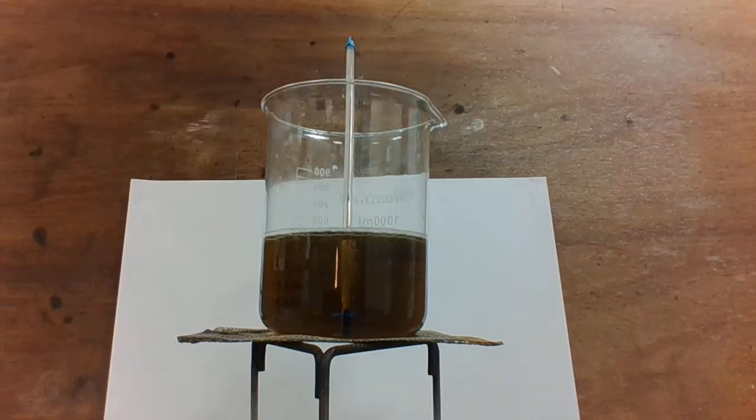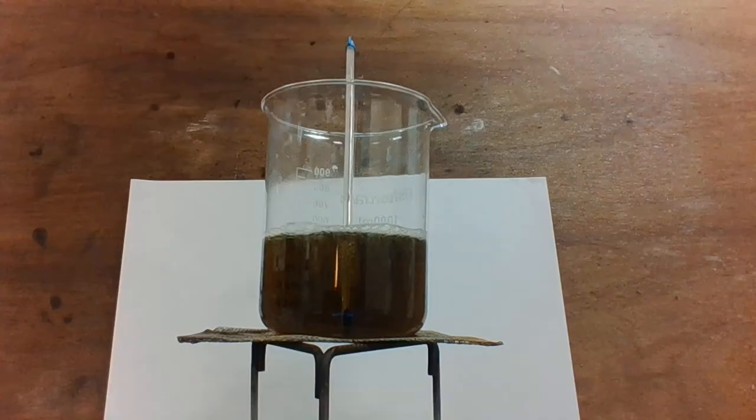The reaction is speeding up and the catalyst is clearly getting involved in the reaction because of the color change.